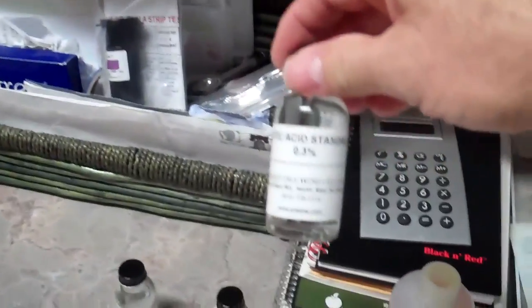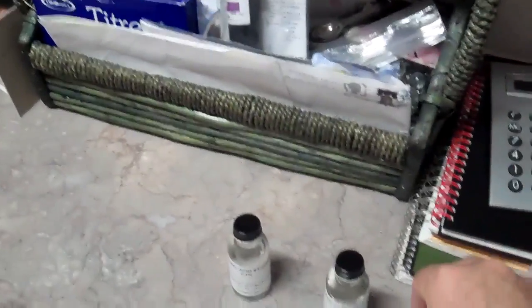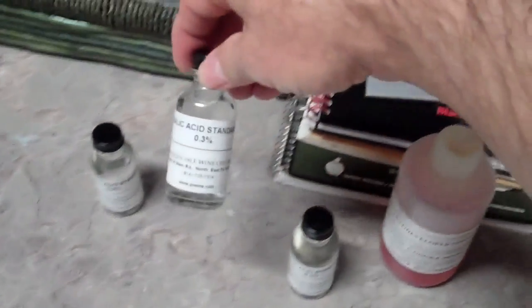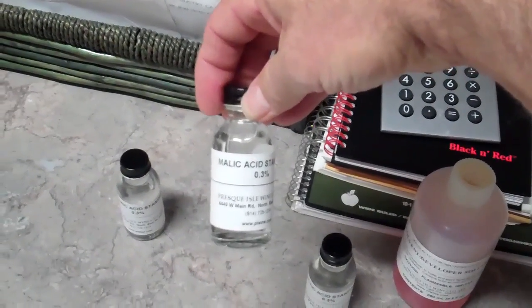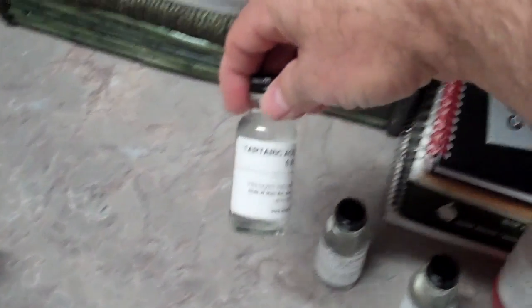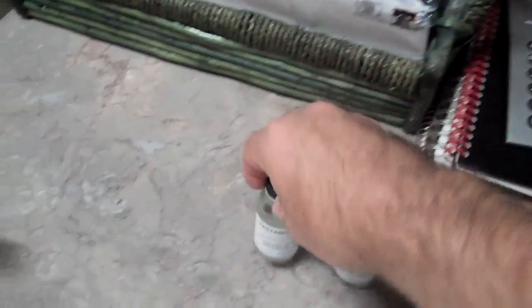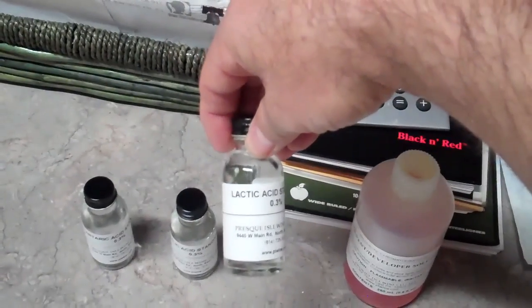My kit also came with three different acid standardization solutions. One obviously being malic acid, another one being tartaric acid, and the third being lactic acid.